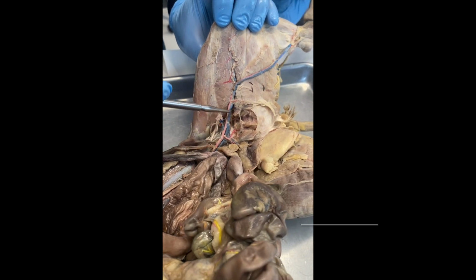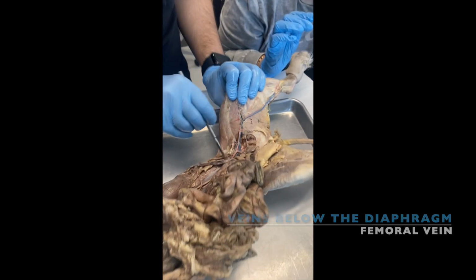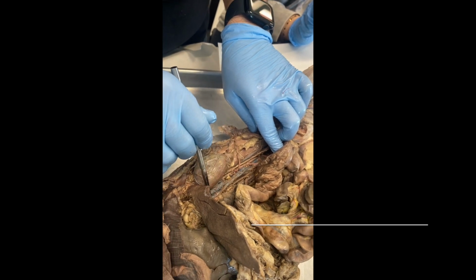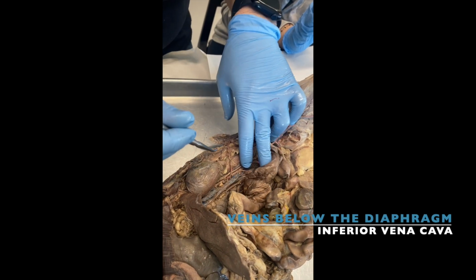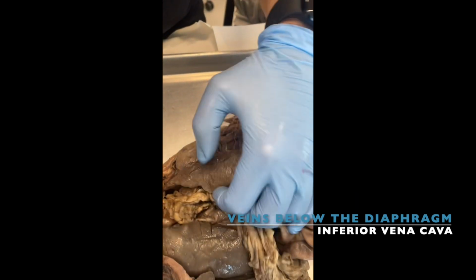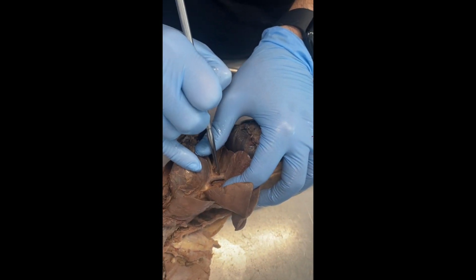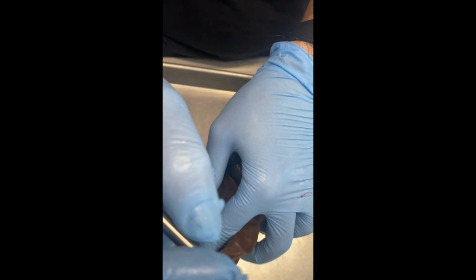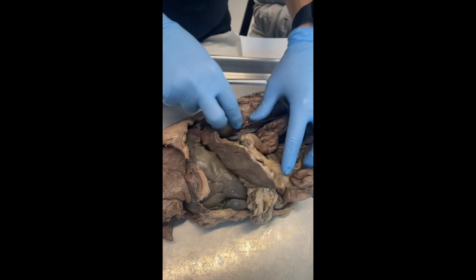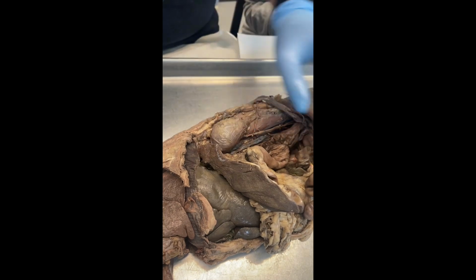And what's the blue one? Femoral vein. Very good. Femoral vein connects back into the, what's the name of this big blue vessel? Inferior vena cava, right? So this big blue vessel is inferior vena cava that goes all the way to what? To your heart, right? So you have inferior vena cava right there, and also the, what she said? Superior vena cava, right there. Well, I already pointed out the renal vein right there. What else do we need to know?